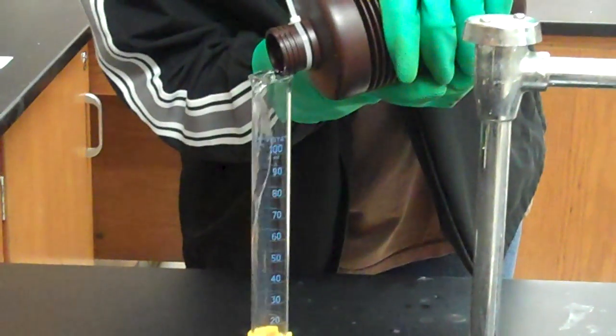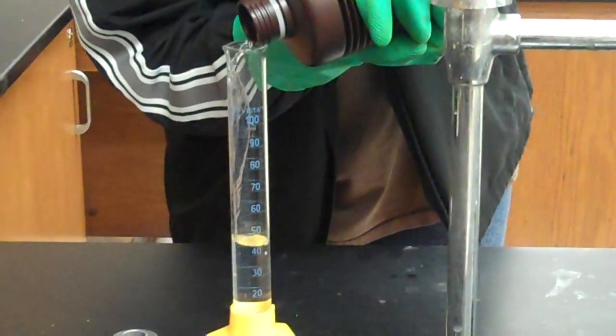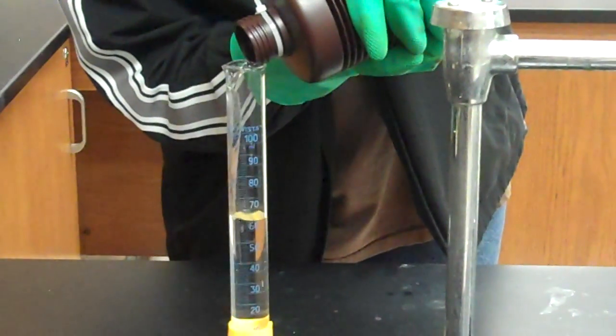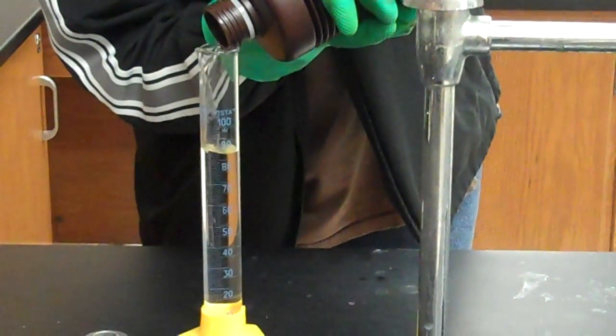As we are pouring, I'm going to explain hydrogen peroxide. After a while, it starts decomposing, which is what this experiment is all about. We are going to use a catalyst to make the decomposition go faster.